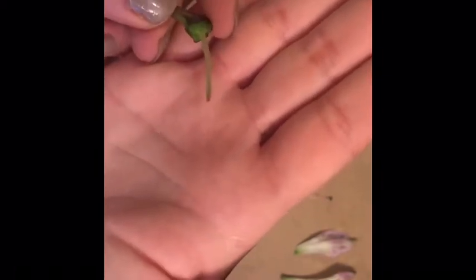Not really knowingly, they just kind of do it. And it would accept the pollen and then take it down the style, and it would create pollen tubes within this style here and take it all the way down to the ovary. So it's hard to see. So I am going to take off our style and our stigma, and I'm going to open up the ovary and show you what's inside because it's super cool.